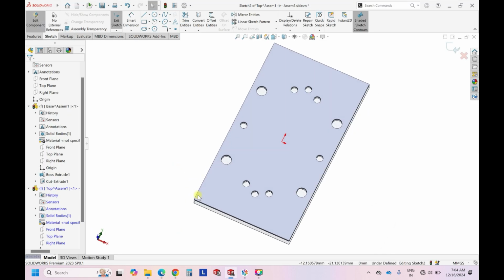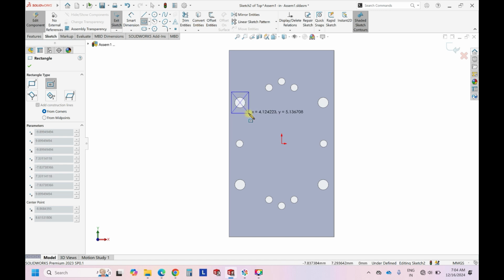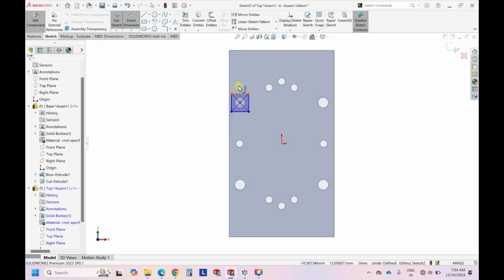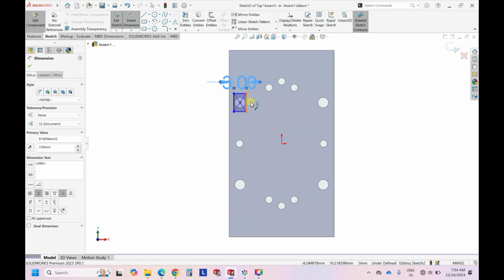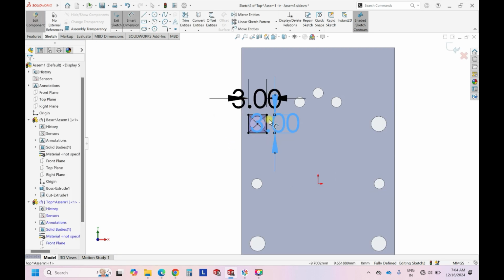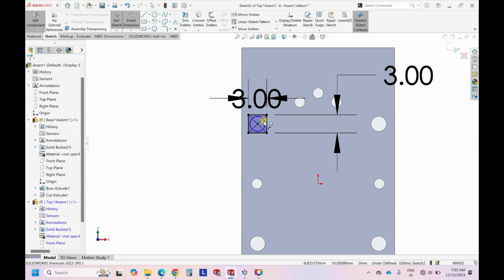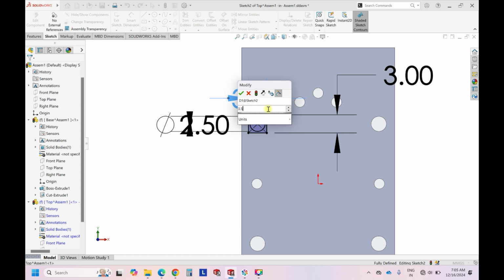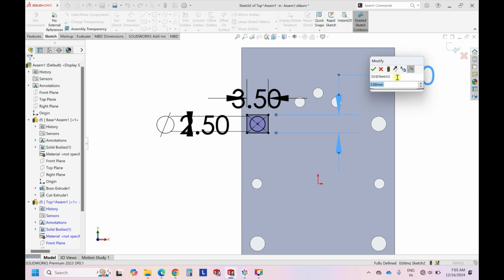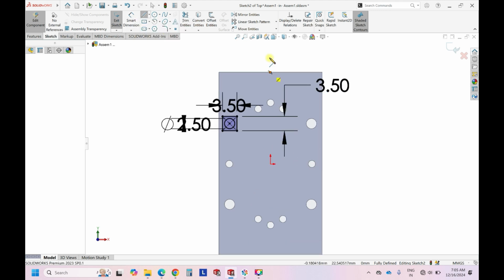But I always prefer to create supports for the tubing. So it can be like this. We can give the dimension as 3 mm. This can again be 3 mm. There should be an inner circle as well, right? For this I think it is better to have 3.5 mm because the wall thickness is low, so after printing there are high chances that it will be broken. Right, so it's done.